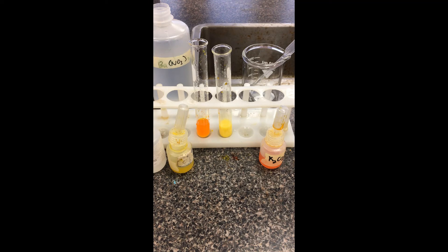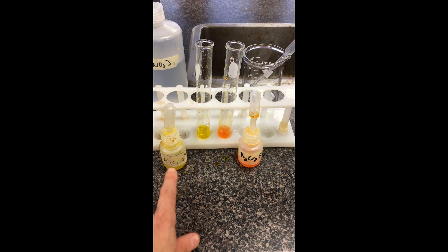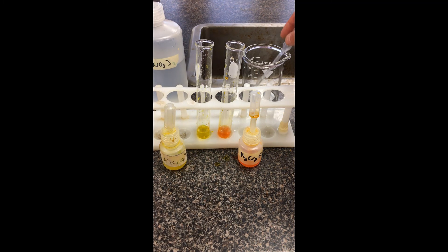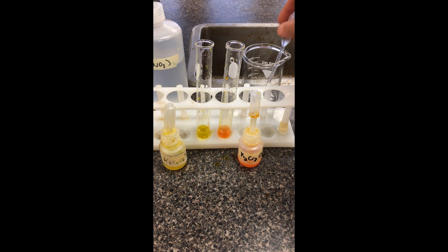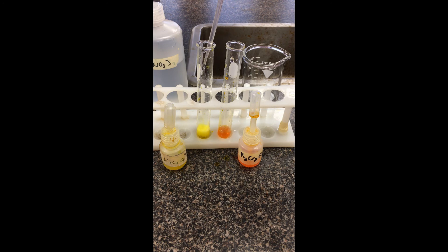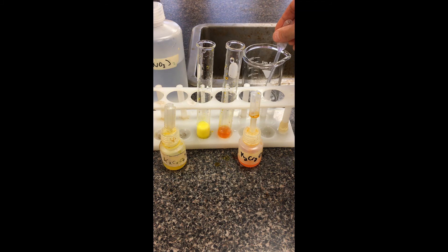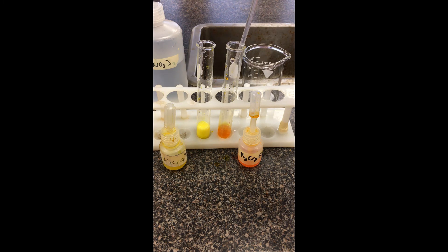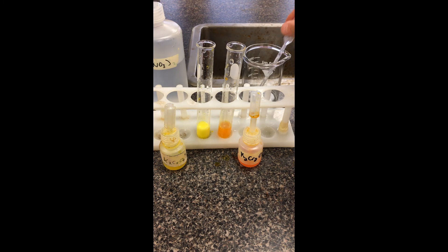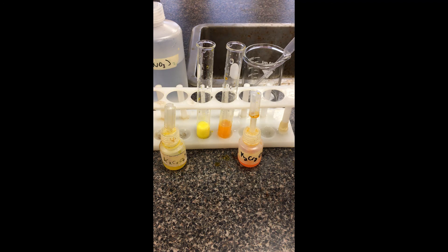We're going to reset one last time. We have our yellow chromate solution and our orange dichromate solution. This time I'm going to take the barium nitrate and add it directly to both solutions, noting any possible changes. This one is getting fairly cloudy. Noting any changes in color and changes in clarity. And that's station four for us.